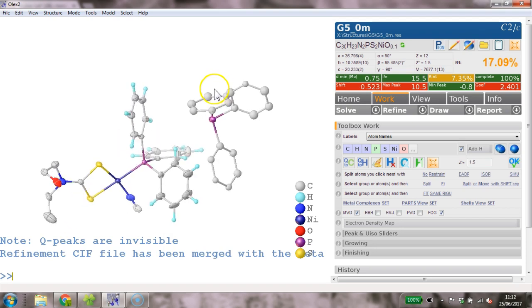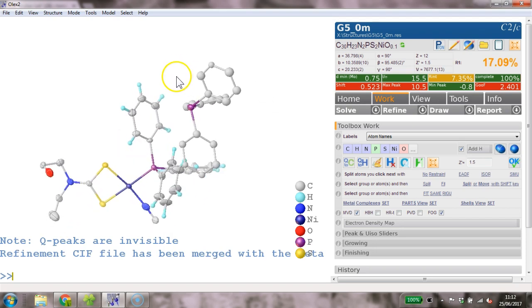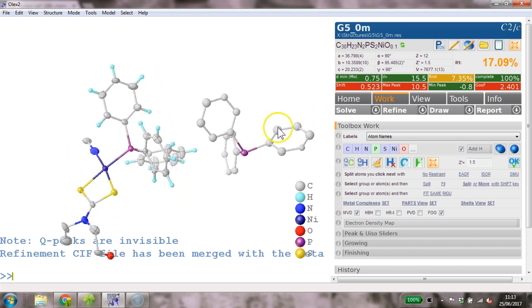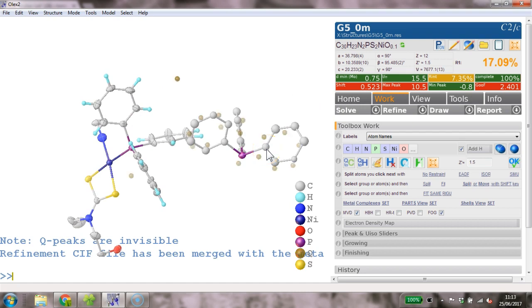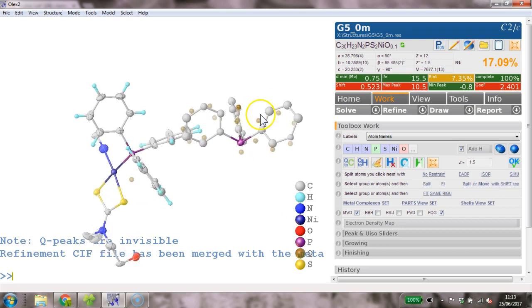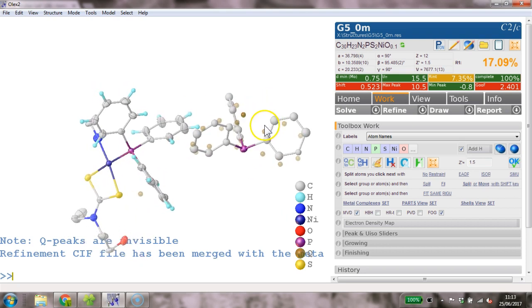So this is just for the moment. I'm not keeping this to the end. I can't actually see much disorder going on down here, but let's deal with this later. Let's first deal with this triphenylphosphine. Control Q to switch Q peaks on. Now we have the Q peaks with no bonds, peaks with bonds and no Q peaks, and now we've got the peaks back. So what we want is another one of those triphenylphosphines on top of each other.